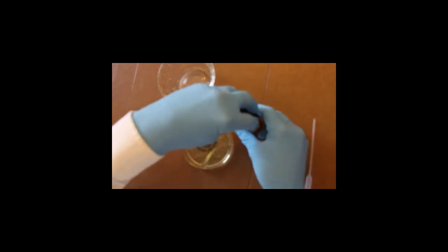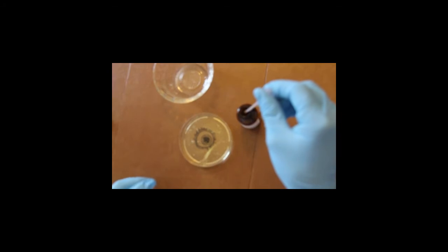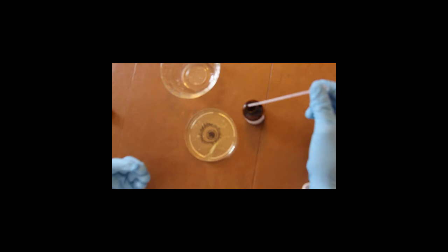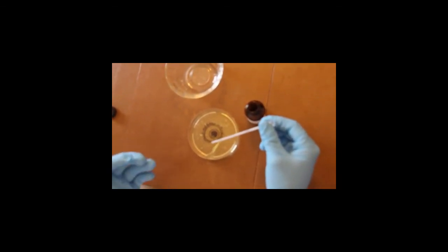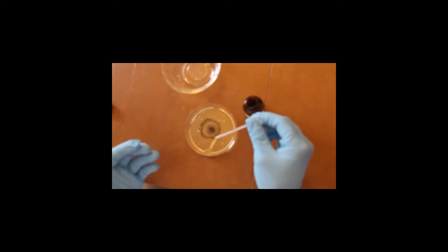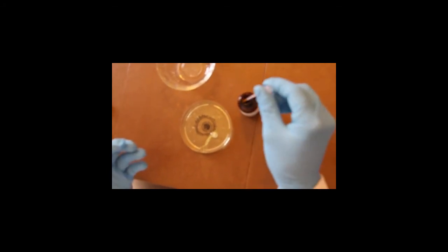And this is where I'm going to use these really safe techniques. As you can see here, a small bottle of sulfuric acid is preferred along with a pipette so that we don't spill acid anywhere. And I'm just going to take a little droplet here. And this is going to demonstrate what would happen if sulfuric acid was to get in the eyes. And this would result from a student maybe not wearing their goggles or wearing them incorrectly. So here we go. Here's just one drop of sulfuric acid. And I'll do a larger drop here so you can see it in more concentrated amounts.